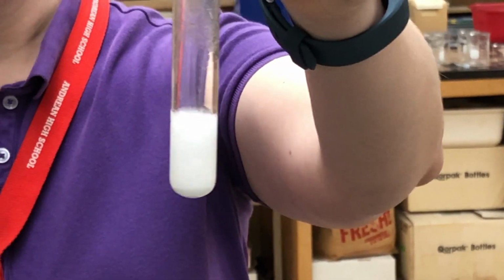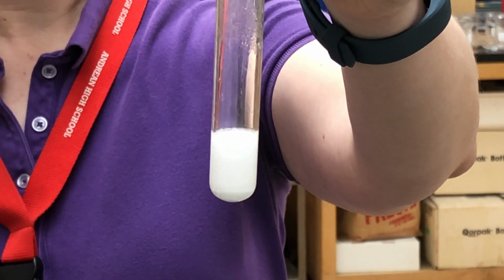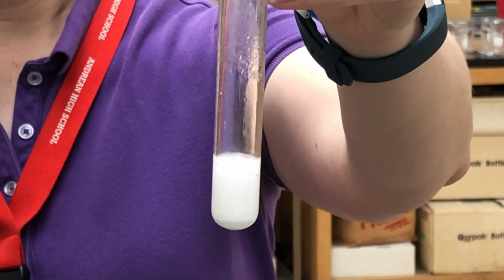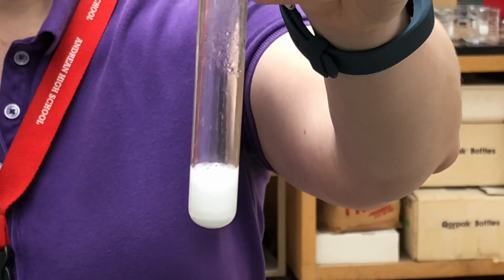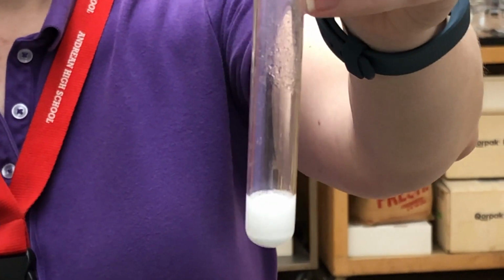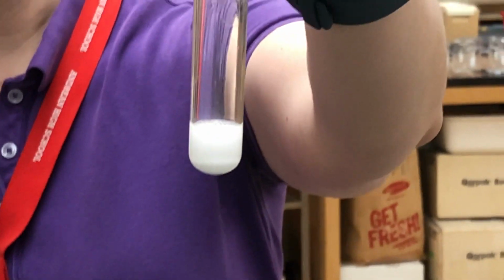So we're having a temperature change. I can hear fizzing. Just about done reacting now.